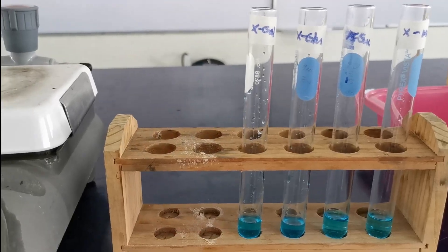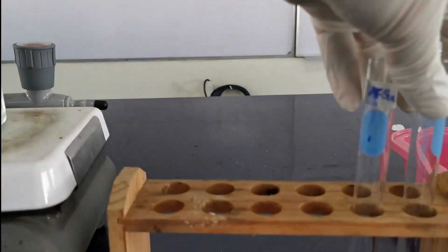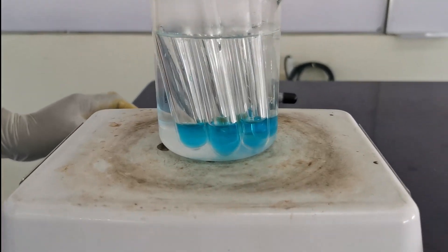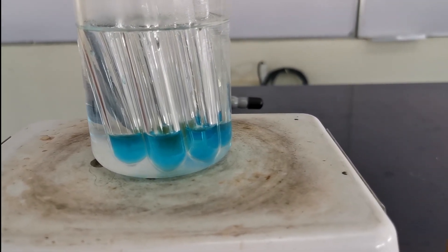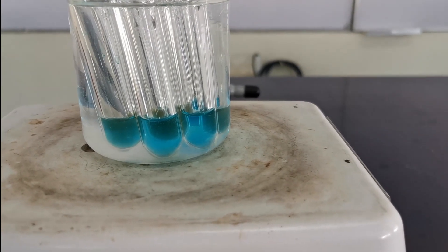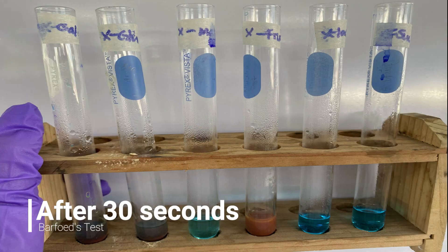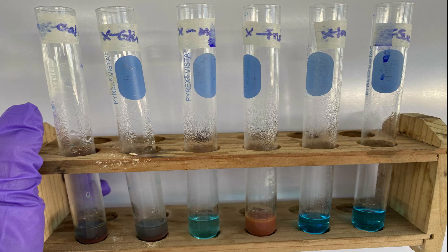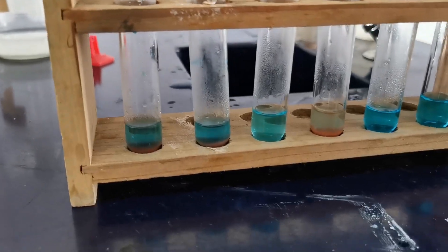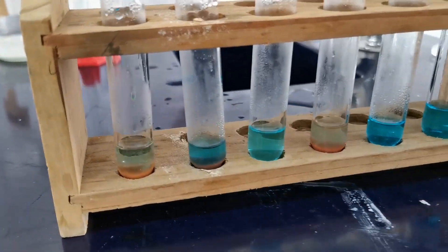Heat for 30 seconds and allow to stand for 10 minutes. Then add 5 drops of 6N hydrochloric acid to each test tube and heat again for 5 minutes. Observe the changes in each tube.